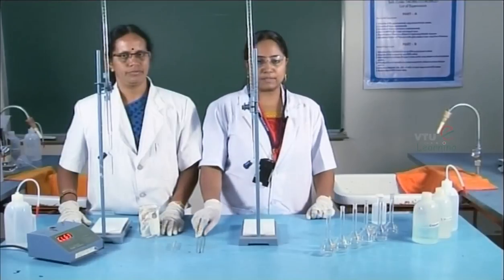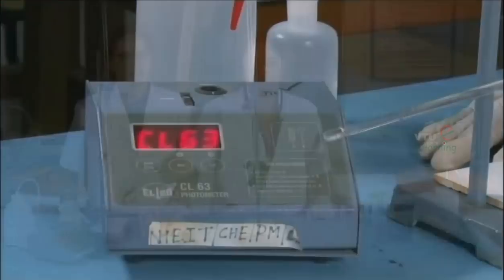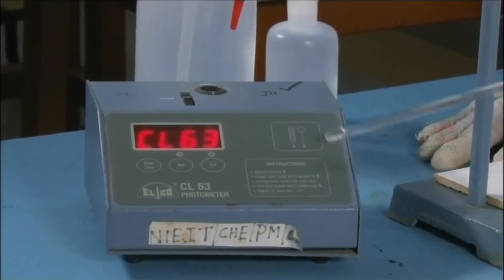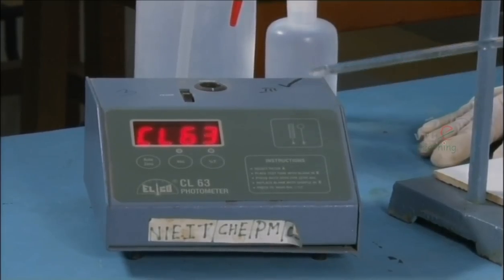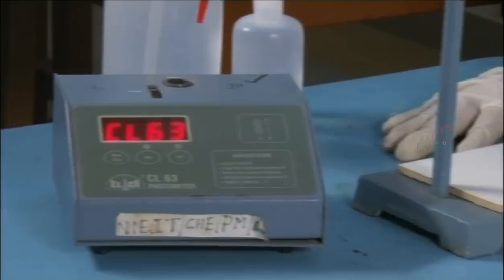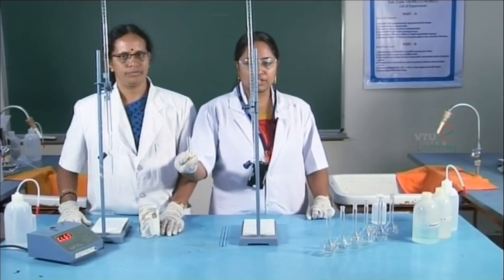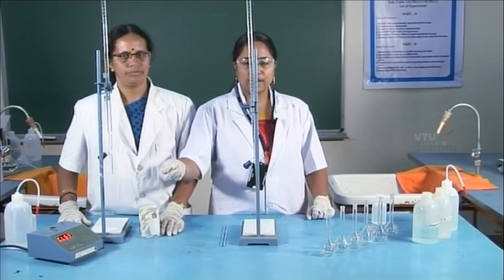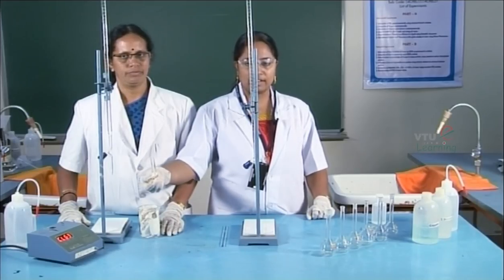Now let us see how to carry out this experiment. The instrument used is a colorimeter. The filter is fixed to 620 nanometers for colorimetric estimation of copper. For measuring the absorbance of colored solutions, the solutions are transferred into a cuvette and the measurements are done.